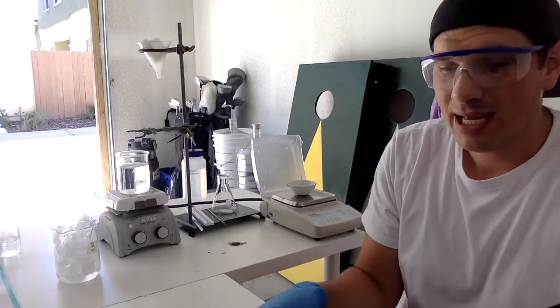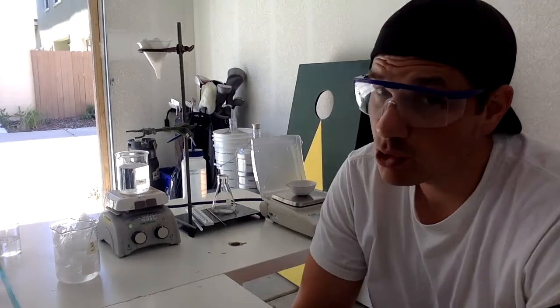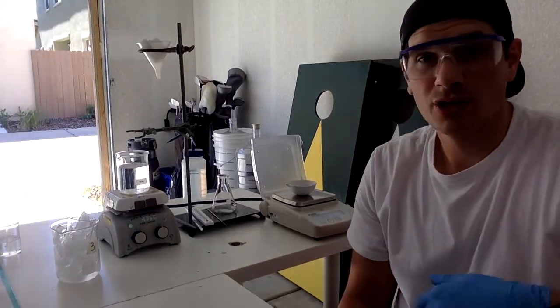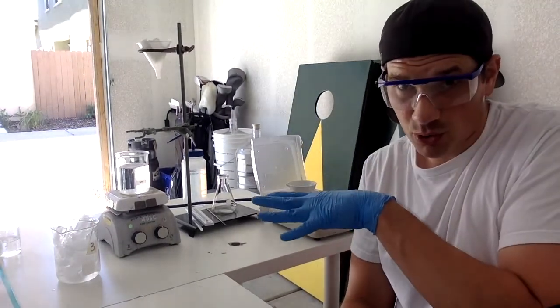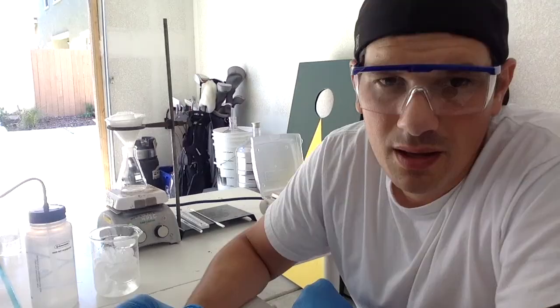Then I'm going to pour my aspirin and filtrate into this funnel setup I have right here. So in the meantime, I'm going to get that funnel setup situated, and we're going to try to get these crystals weighed out to see how much aspirin we actually made. Then I'm going to recrystallize. I'm going to show you that step just to get a more pure sample for when we do the iron test, okay? So when we come back, I'm going to go through the filter setup and we're going to keep continuing on. All right, guys.